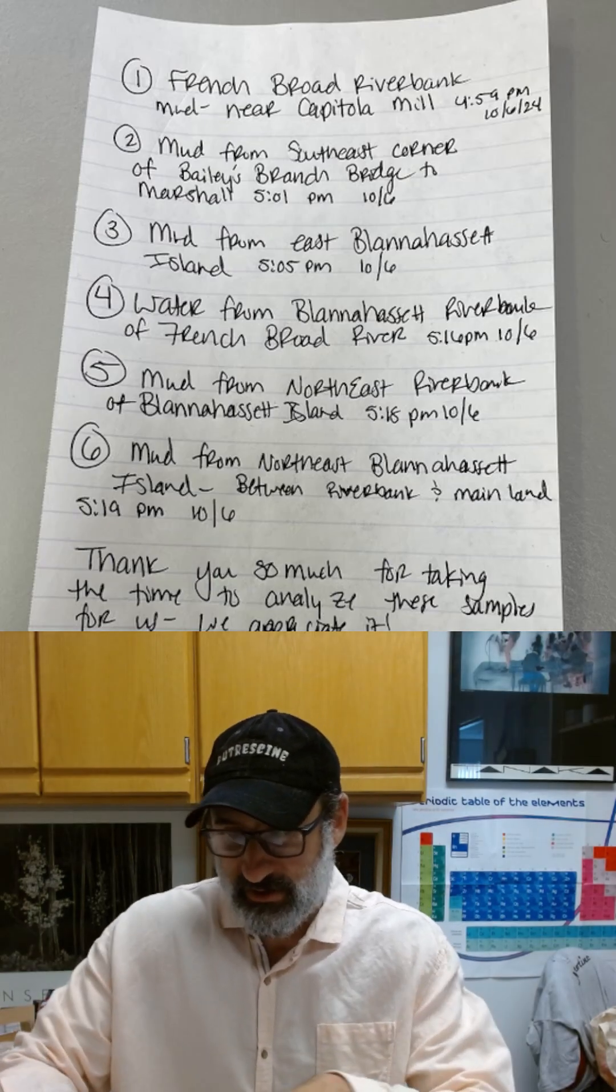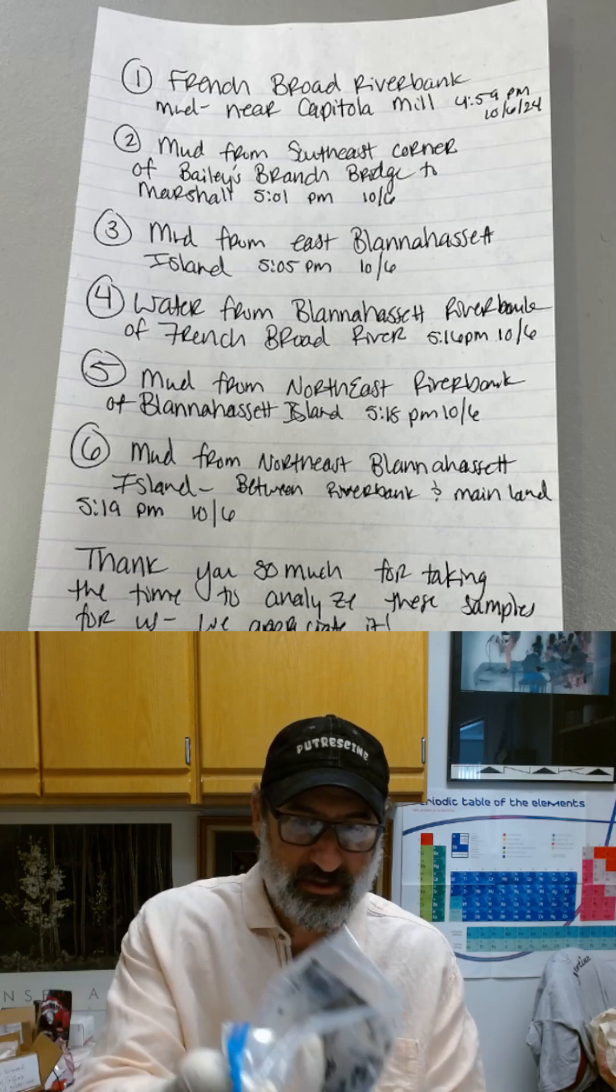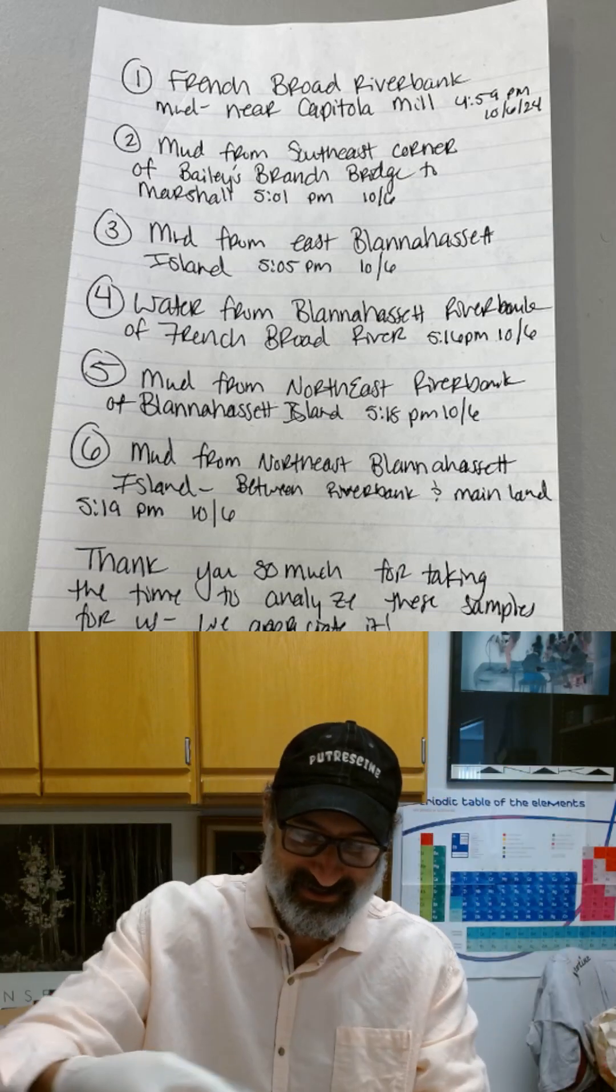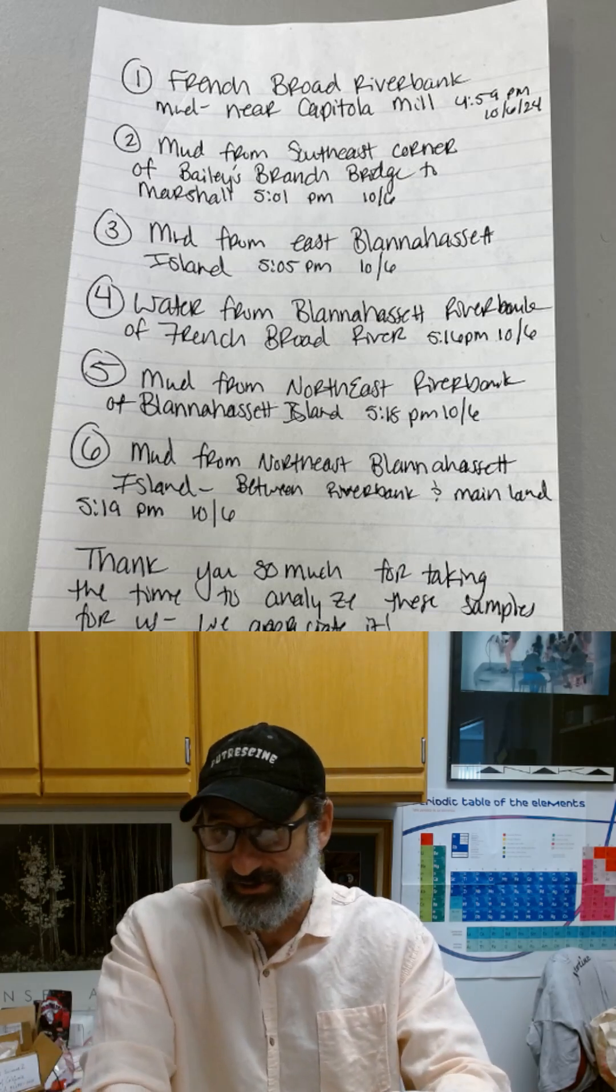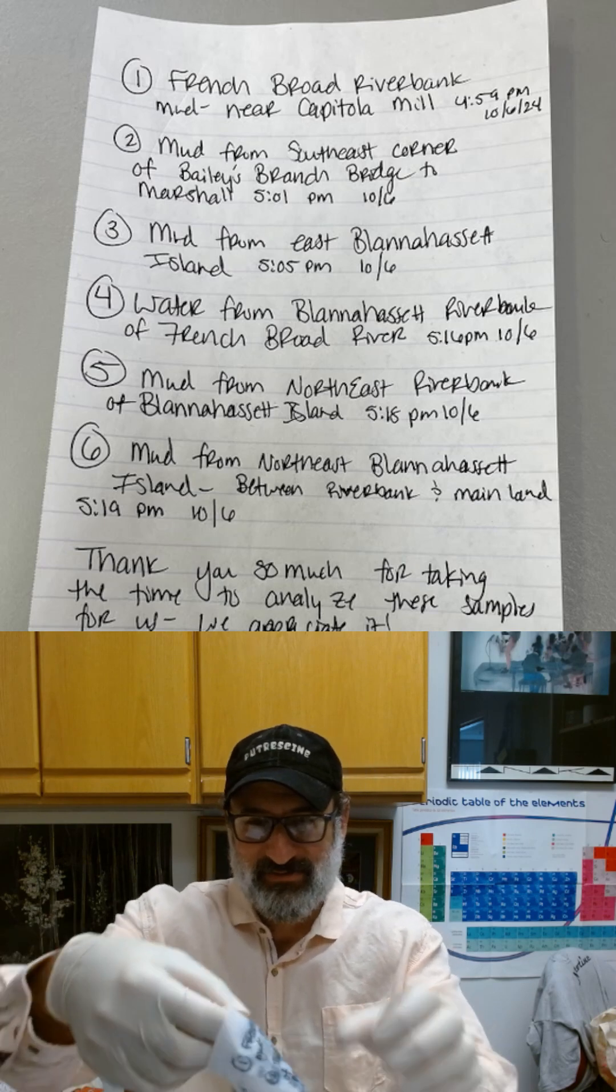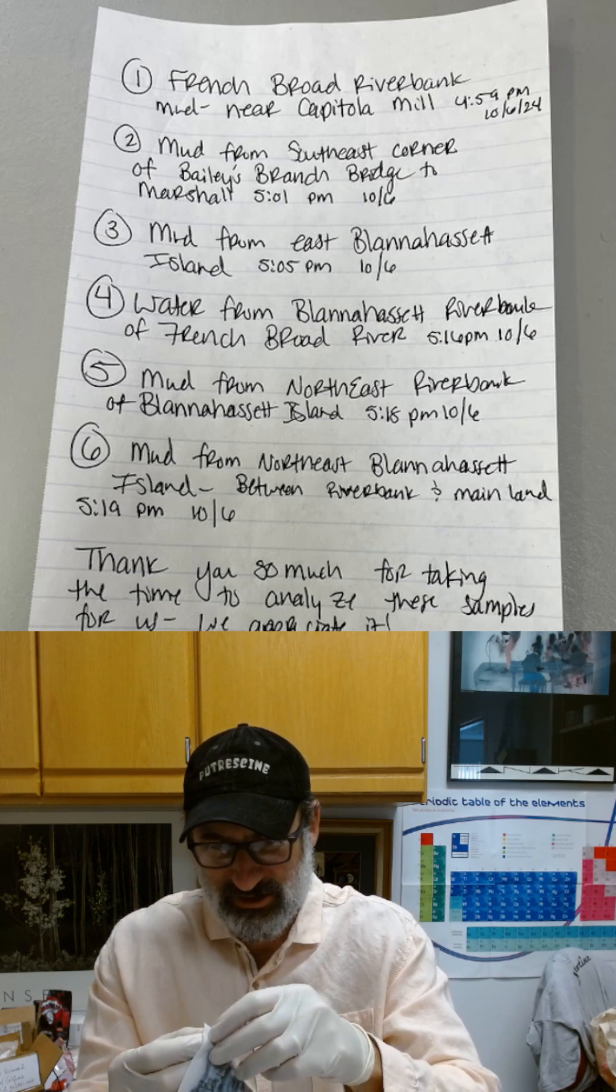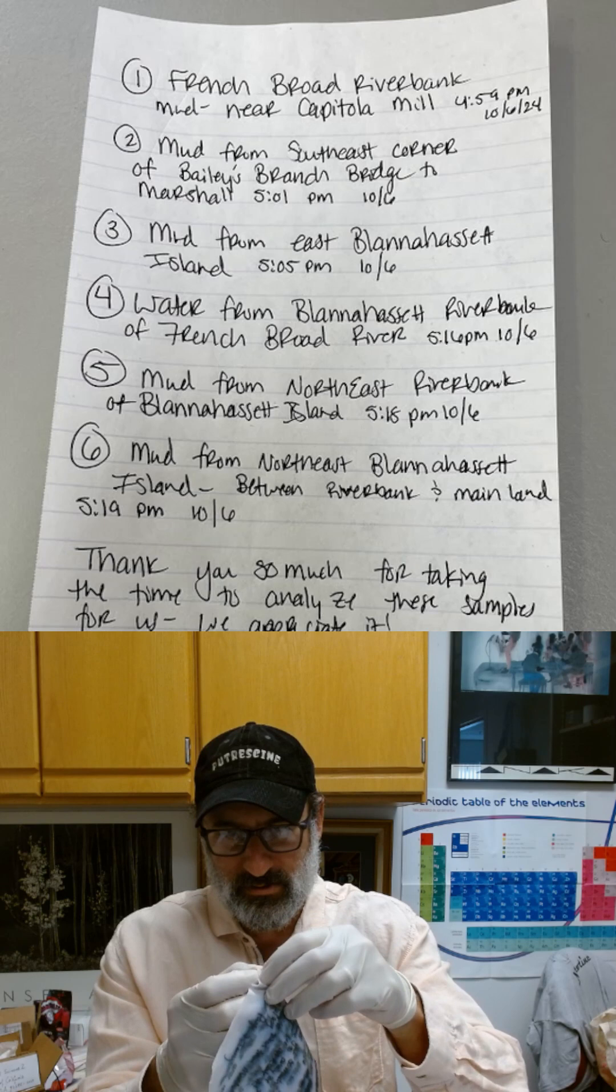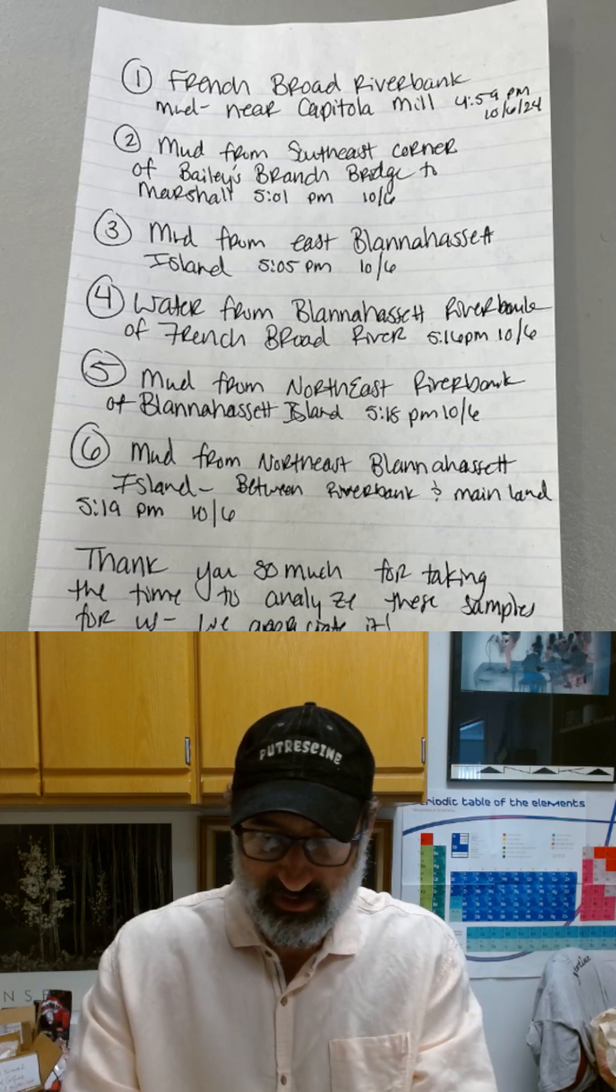Let's go ahead and live open the package from North Carolina. We should glove up. Alright, we've opened this. Here we go. Ziploc bag. It has been leaking. It's a little worse for wear. Not that stinky. The note. Luckily they took a photo of it. The note is all wet. I'm going to have to just lay it out and try to dry it without unfolding it. It's covered in French Broad River flood water.